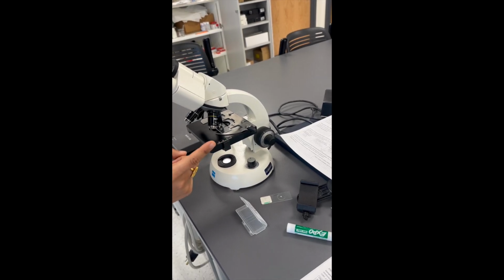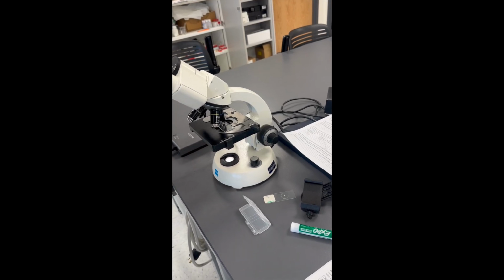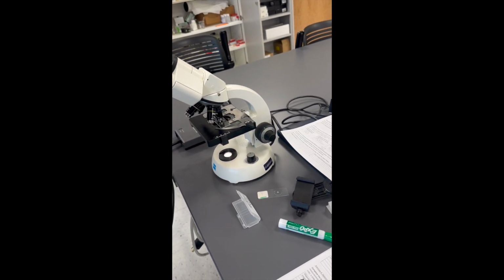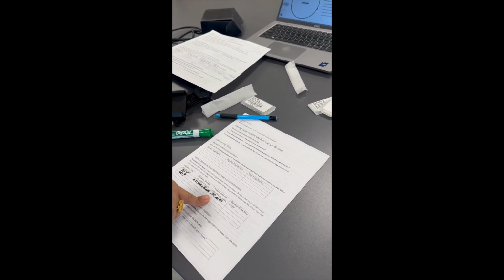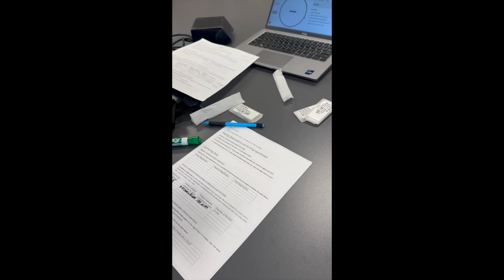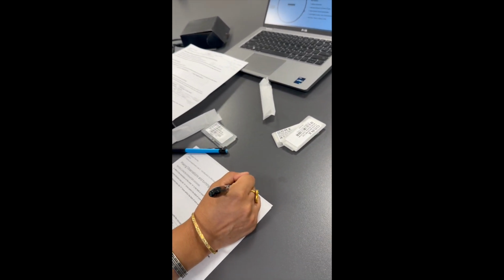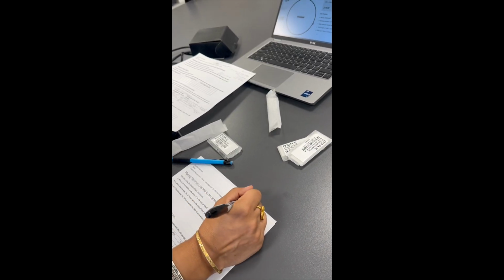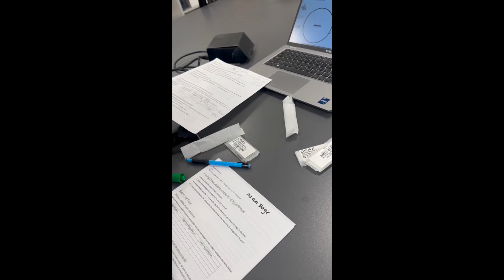So that's 1, 2, 3, 4, 5, 6, 7, 8 ocular micrometer numbered tick marks to 2 stage micrometer tick marks, or 4-to-1. How would I calculate that? Well, I would say that I have 100 micrometers on my stage, because we figured that the distance between numbered tick marks was 100 micrometers.